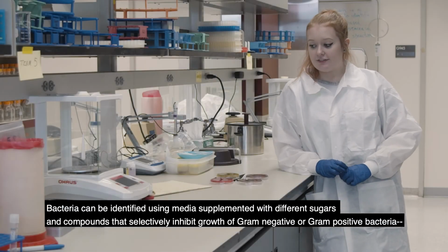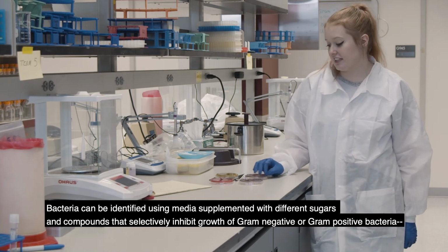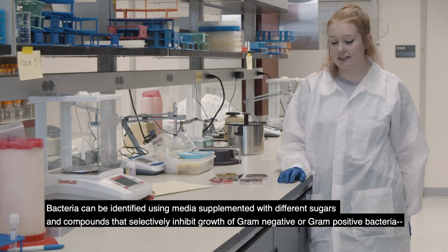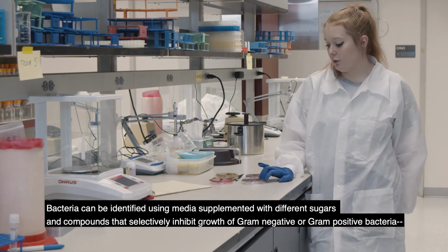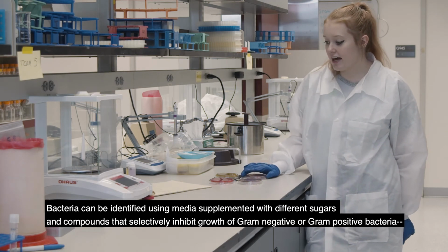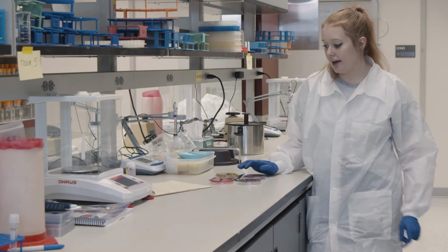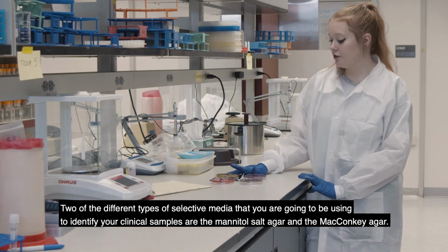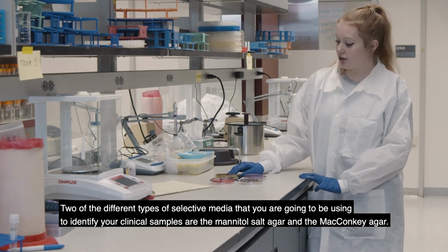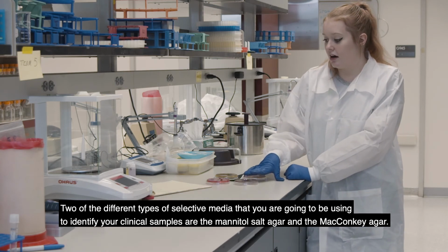Bacteria can be identified using media supplemented with different sugars and compounds that selectively inhibit growth of gram-negative or gram-positive bacteria, or indicator dyes that change color. So 2 of the different types of selective media that you are going to be using to identify your clinical samples are the mannitol salt and the MacConkey agar.